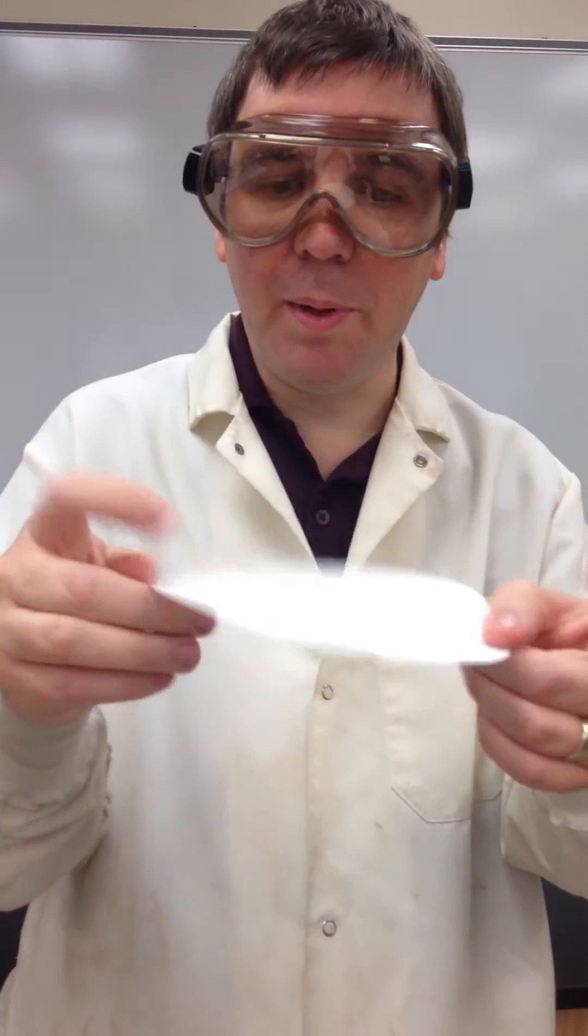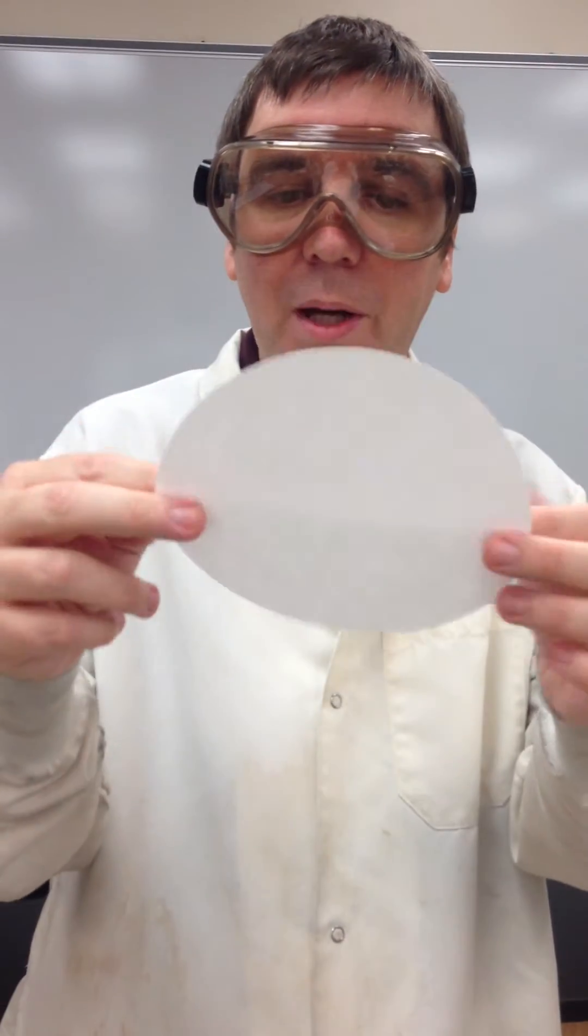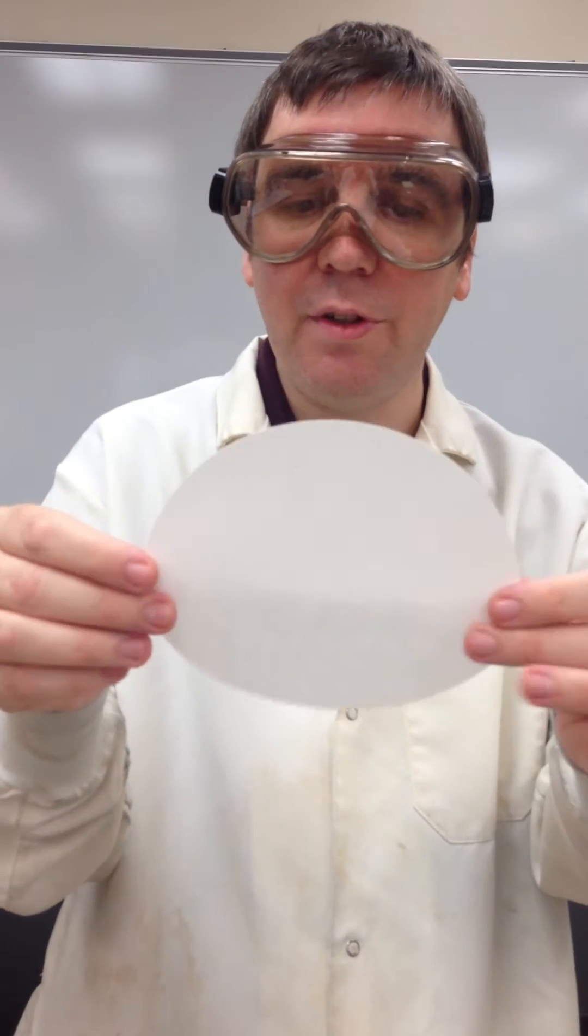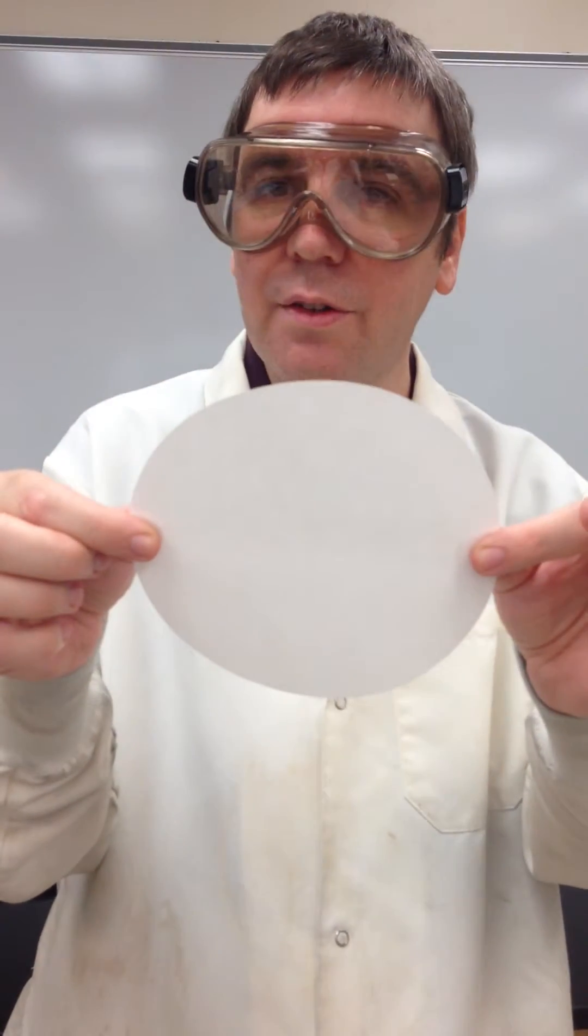I'm going to show you how to flute a filter paper. Obtain a piece of filter paper about this size. This is about nine centimeters.